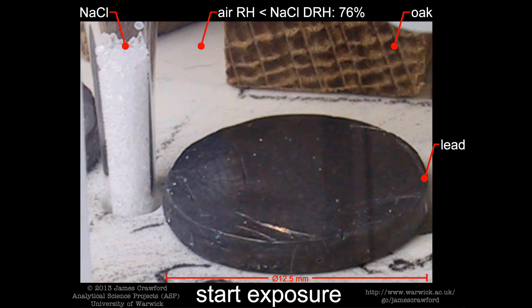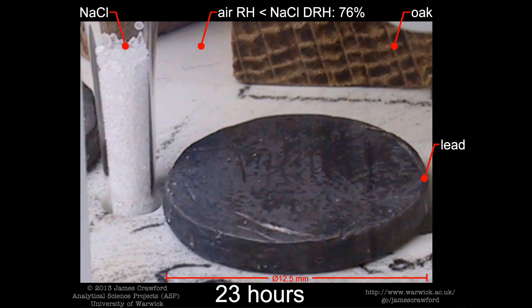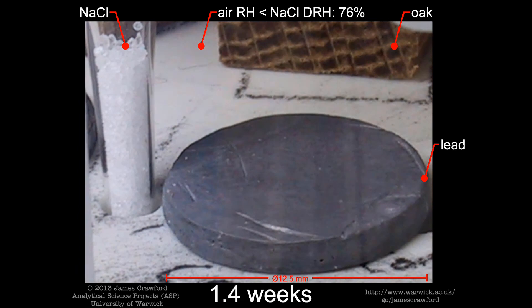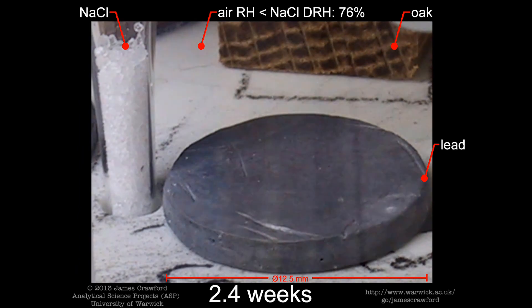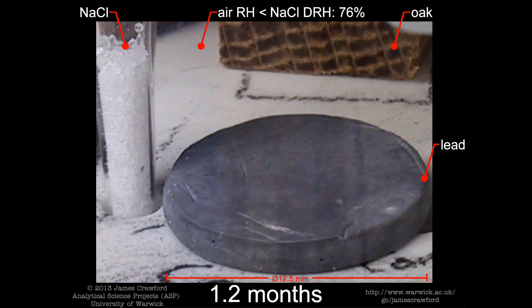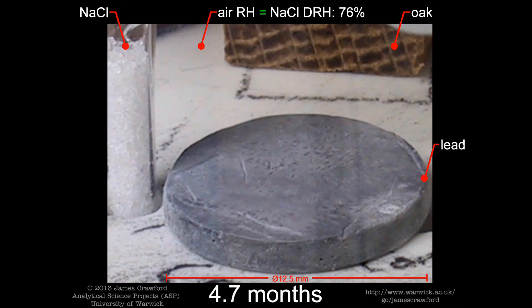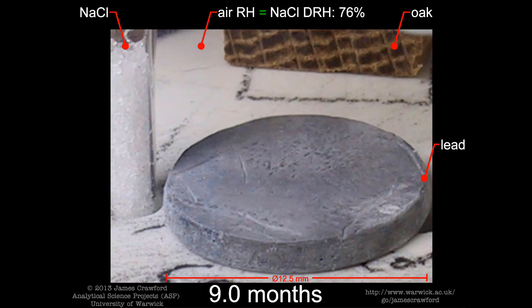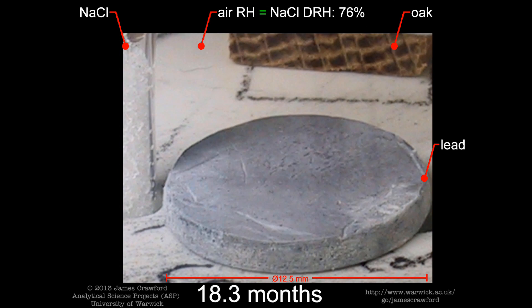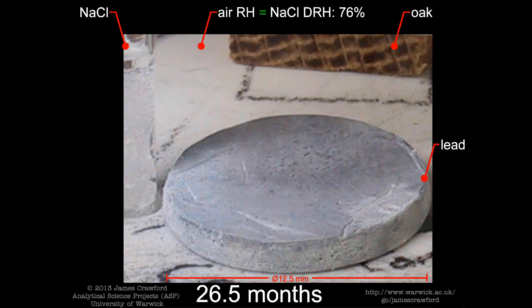Within hours of exposure, the first white corrosion products begin to form. The single salt crystal closest to the chamber atmosphere cyclically absorbs and dissolves water vapour, and it is the first to deliquesce. The saturated salt solution appears to have finally produced a relative humidity of 76%. The equilibrium moisture content of the oak at this relative humidity is reached.